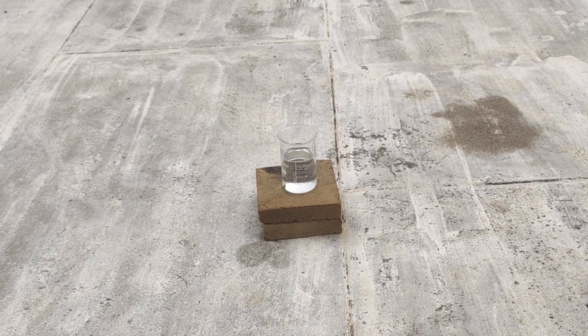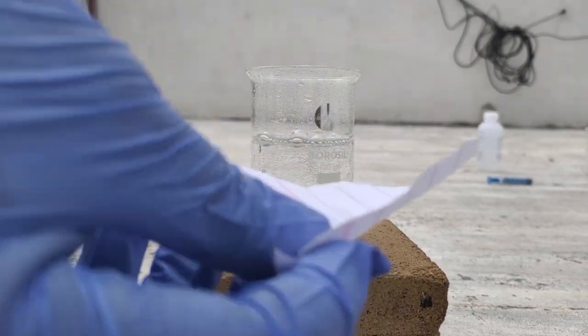This is the piranha solution. So we will add a paper.